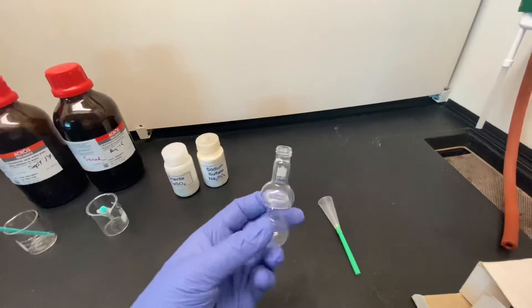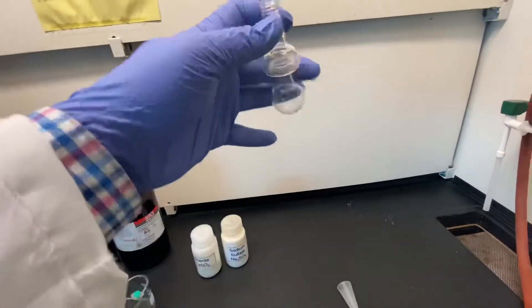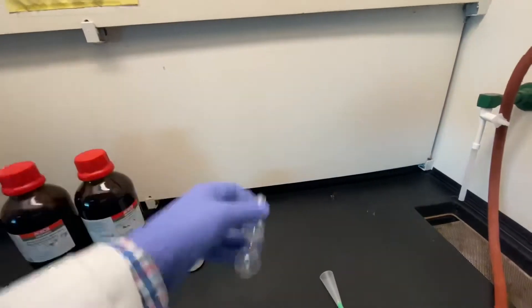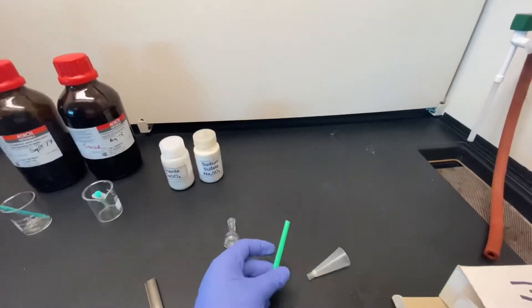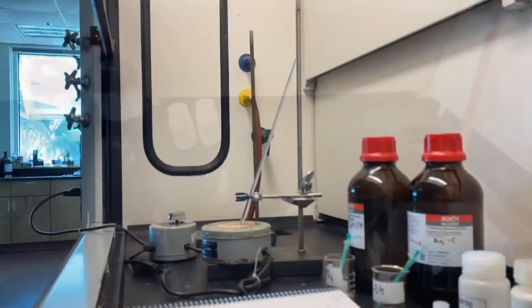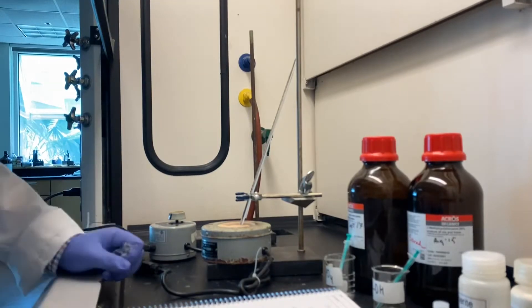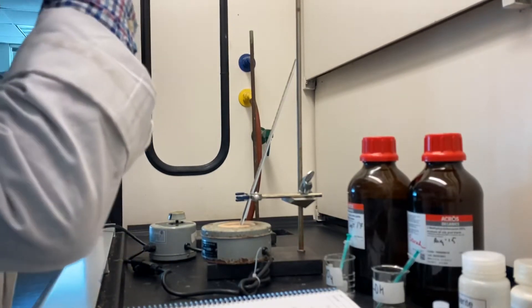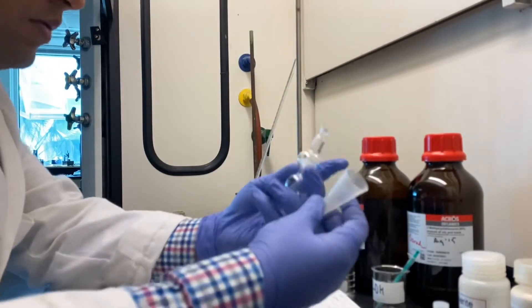This is a Hickman still with an upper and lower bulb. This is a custom-made apparatus and costs both money and time to replace. Insert a short piece of a straw in the plastic funnel from your red box to make a long neck plastic funnel. Make sure the length is up to the bottom bulb.